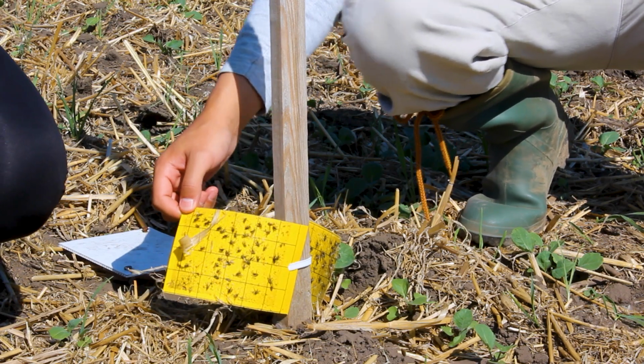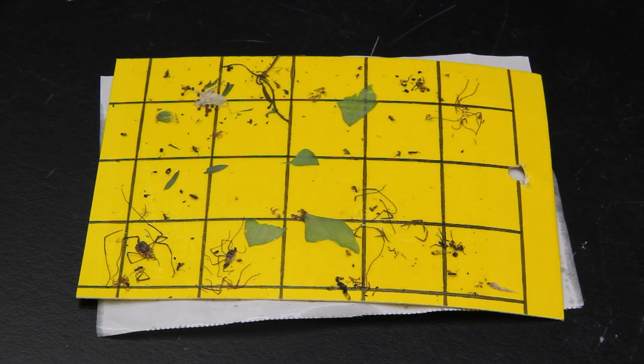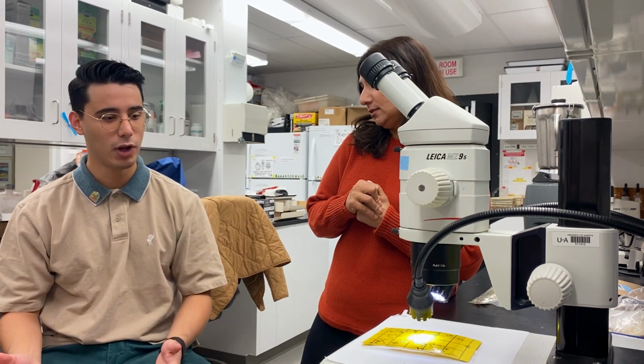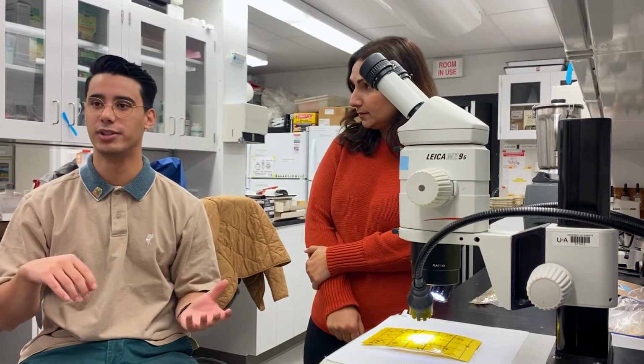So we're at the stage where we are trying to identify and count what we actually found throughout the summer. So far you've been able to find a few of our predators and parasitoids and the major insect, which is the diamondback moth. Yes. So we have been finding very few diamondback moths, a lot of parasitoids in these plots. Once we do the stats behind everything, we'll see if there are differences. But we are finding insects that we are interested in, which is the major point of it, which is good.